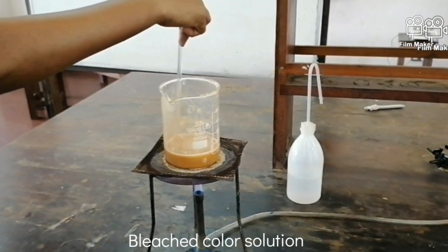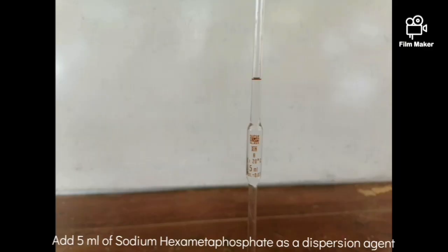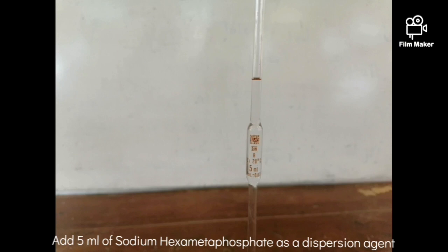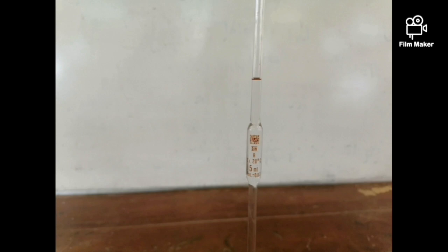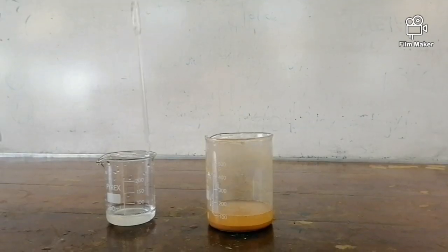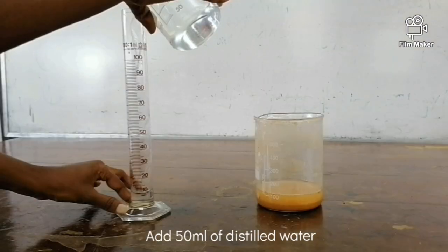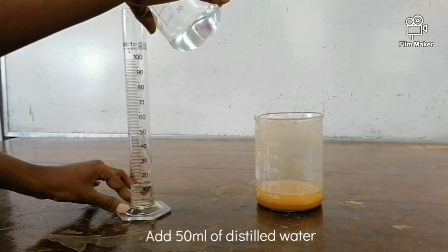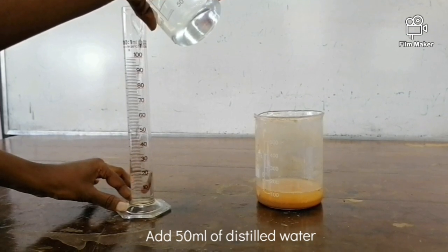Next, add 5 ml of sodium hexametaphosphate and 50 ml of distilled water into the soil mixture. Now stir it for 10 minutes.